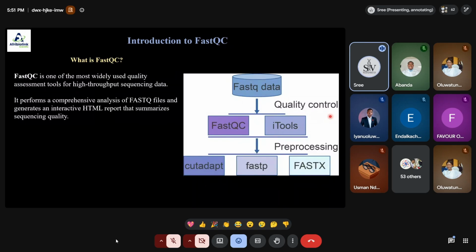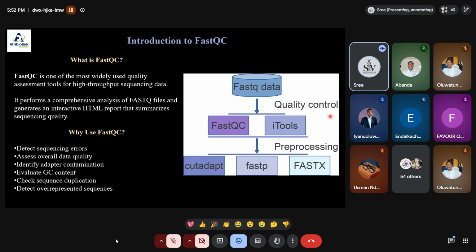To check the quality of the FastQ file, the tool we are going to use today is FastQC. QC is quality control or quality check, used to check the quality of a FastQ file. So once we have the FastQ file, we need to check the quality, and that is done with FastQC.